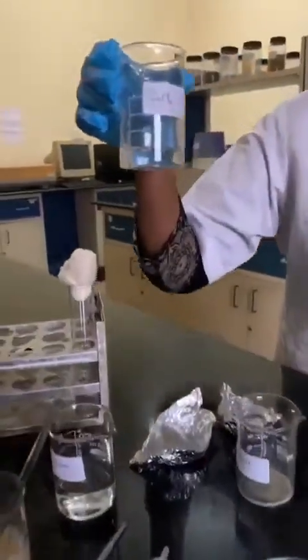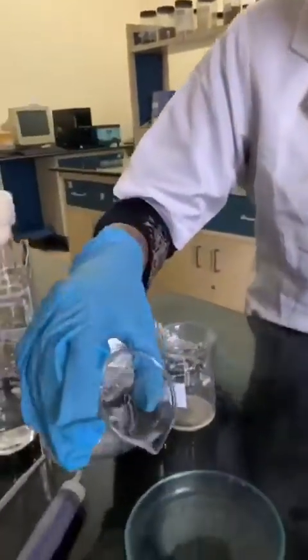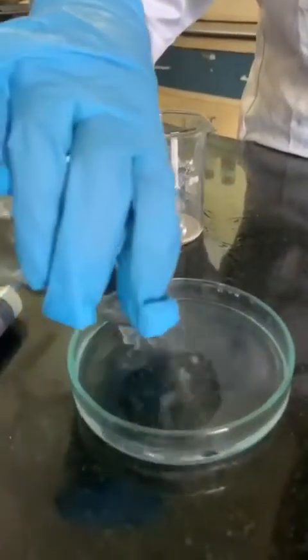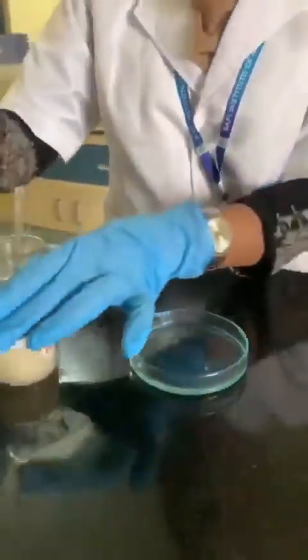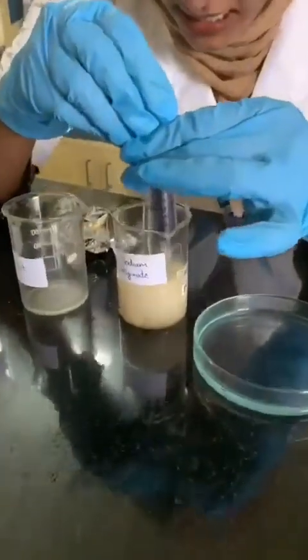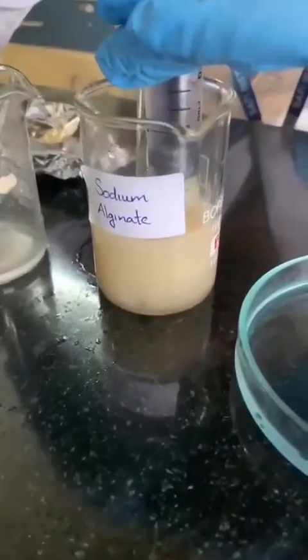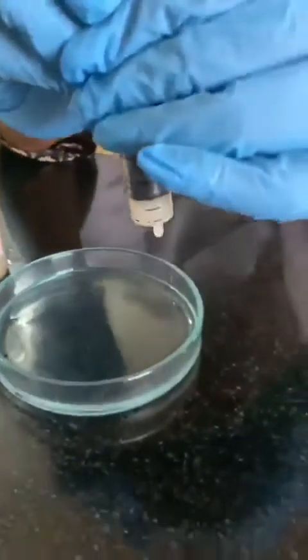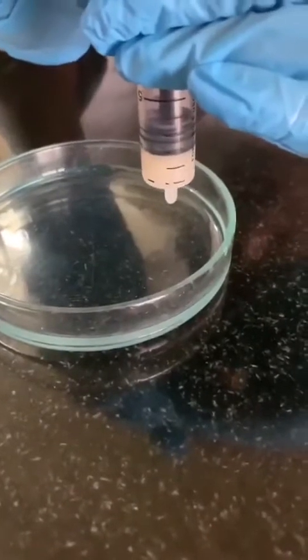Then, pour 0.2 molar calcium chloride solution into the Petri plate, and take 2 ml of the sodium alginate-yeast suspension into the syringe, and slowly add it into the calcium chloride solution drop wise.